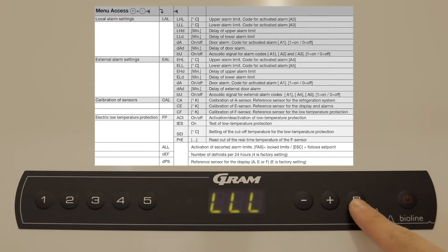Navigate down to the lower alarm limit. Open and set to minus 35 degrees Celsius. Press select and power to navigate back to the menu.